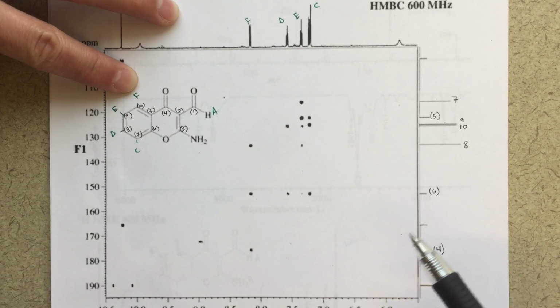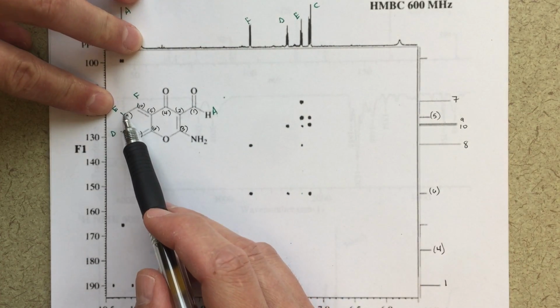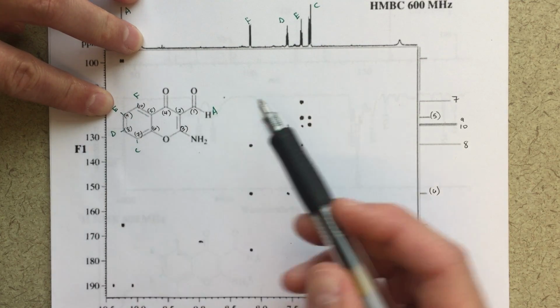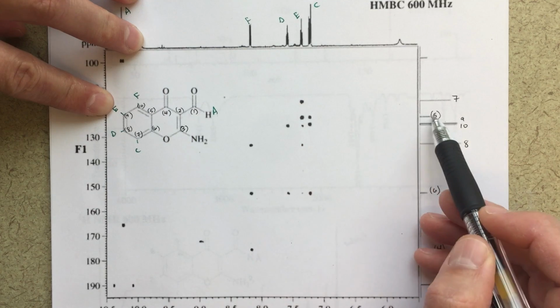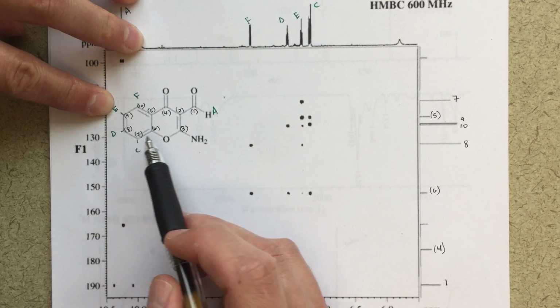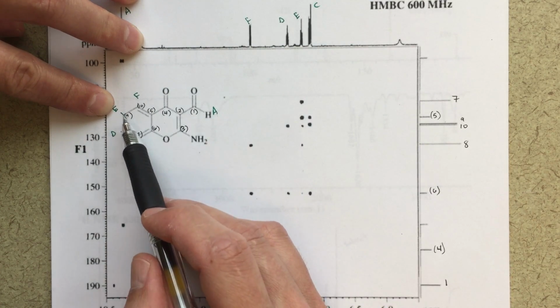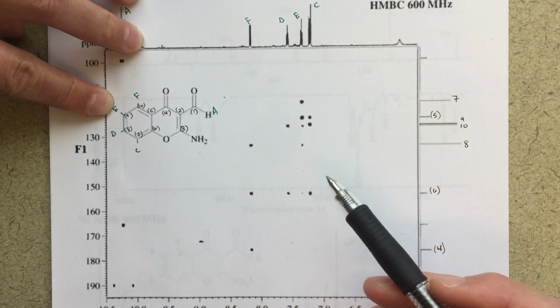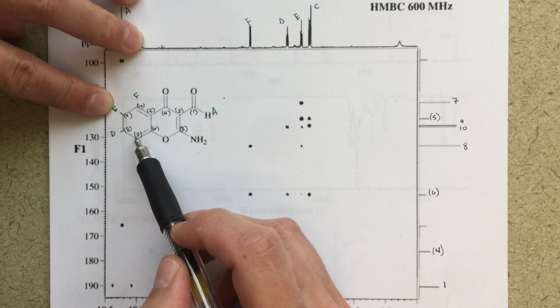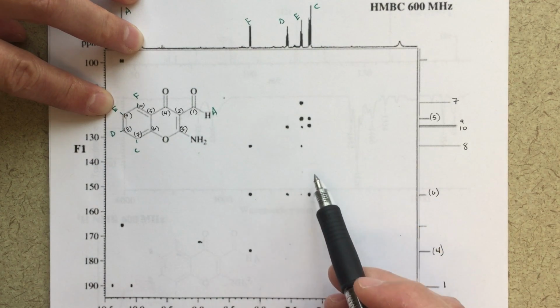We're getting quite a few correlations here, which is great though. So for E, now I've got 1, 2, 3. E should correlate strongly with 5. So E to 5, that's this peak here. That looks good. E should correlate strongly, 1, 2, 3, with 7. So E to 7. So our 2 main peaks for E, the 2 strongest signals we're seeing there, are 3 bond correlations. 1, 2, 3, which is 5. 1, 2, 3, which is 7. Those look good. And then I'm seeing sort of weaker correlations with some other stuff.